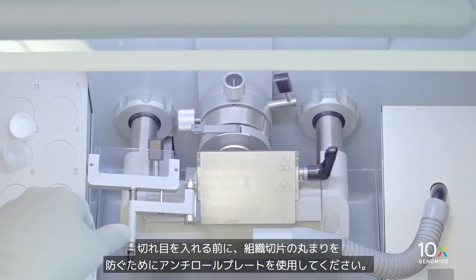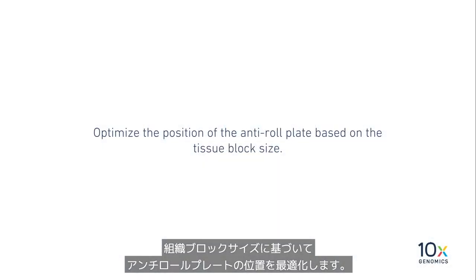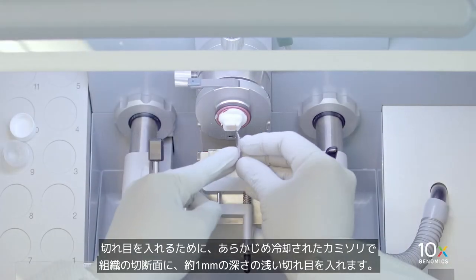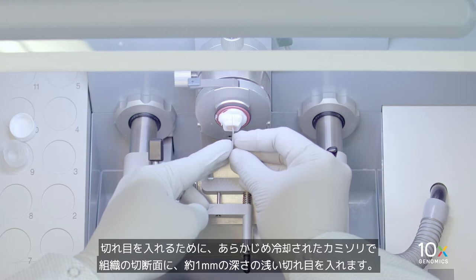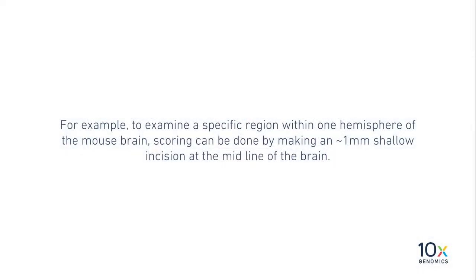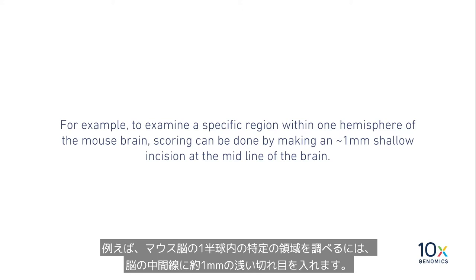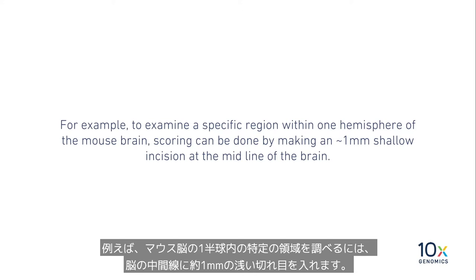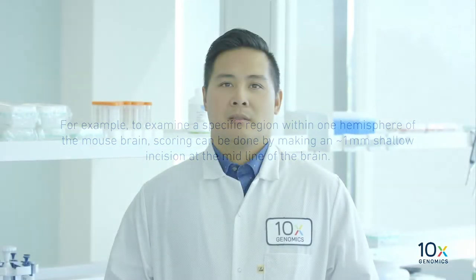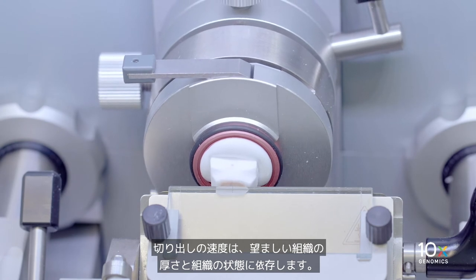Before scoring, remember to use an anti-roll plate to prevent rolling of tissue sections. Optimize the position of the anti-roll plate based on the tissue block size. To score, make a shallow incision about one millimeter deep on the cutting surface of the tissue with a pre-cooled razor blade. For example, to examine a specific region within one hemisphere of the mouse brain, scoring can be done by making an approximately one millimeter shallow incision at the midline of the brain.